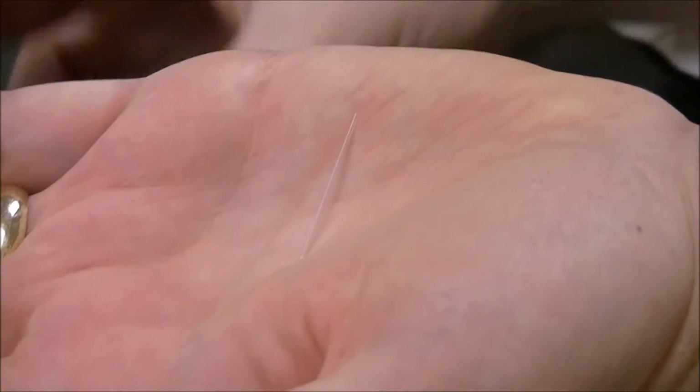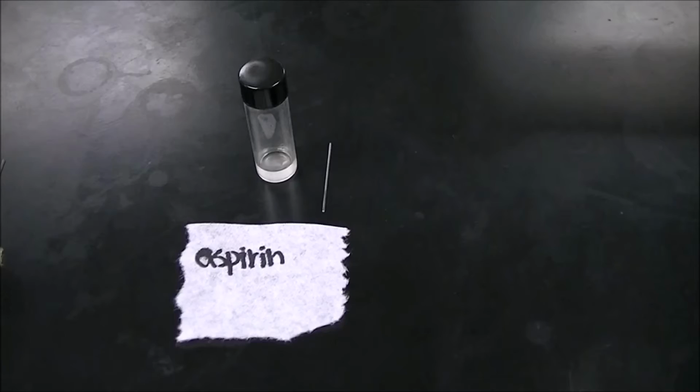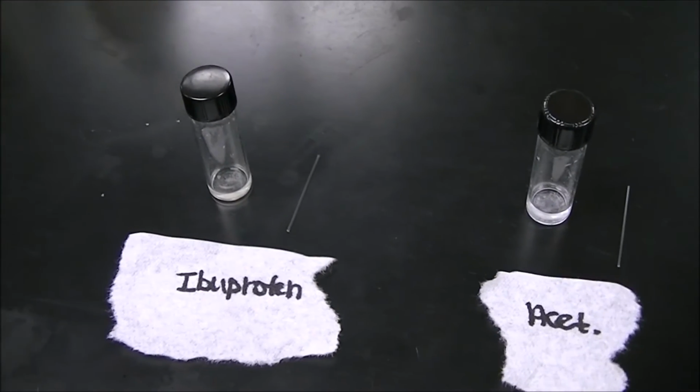Each of these spotters needs to stay with the compound that you start with. Don't mix the spotters up for each of the compounds. Each solution should have its own spotter. Make sure not to mix these up.